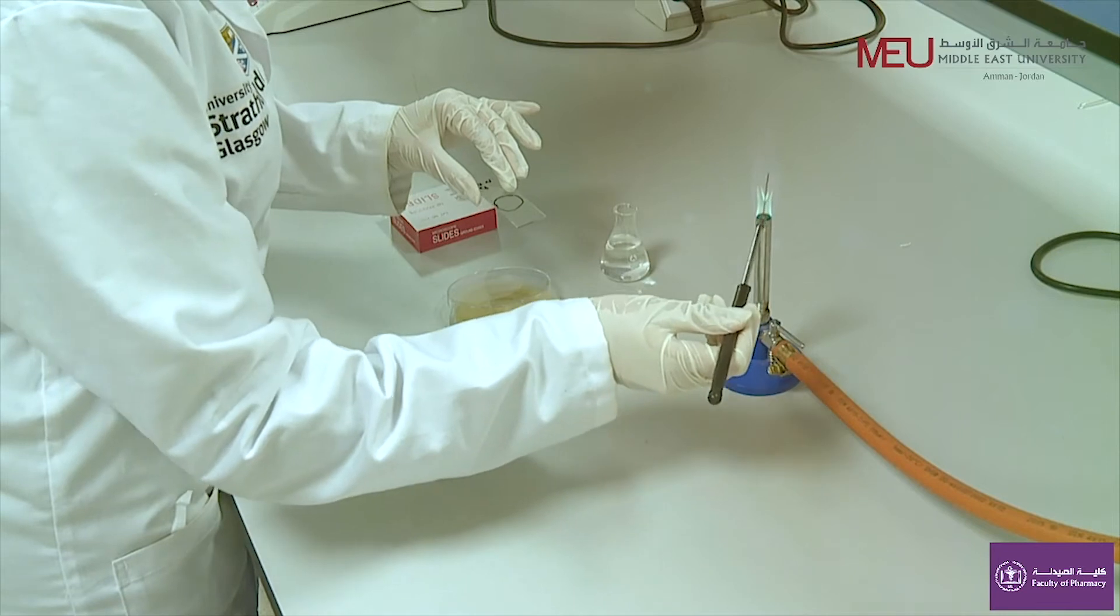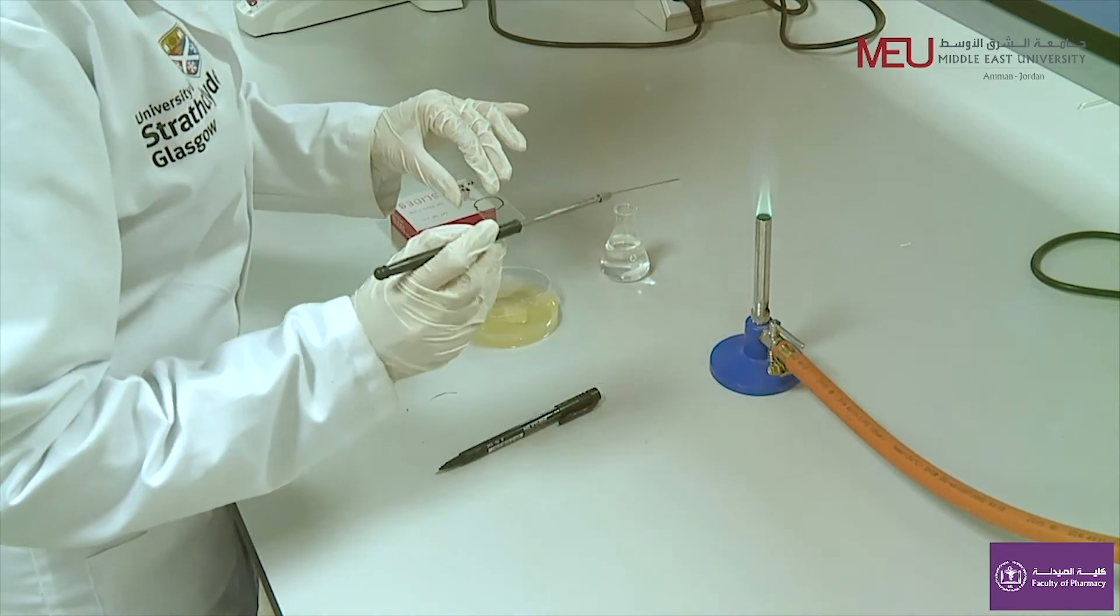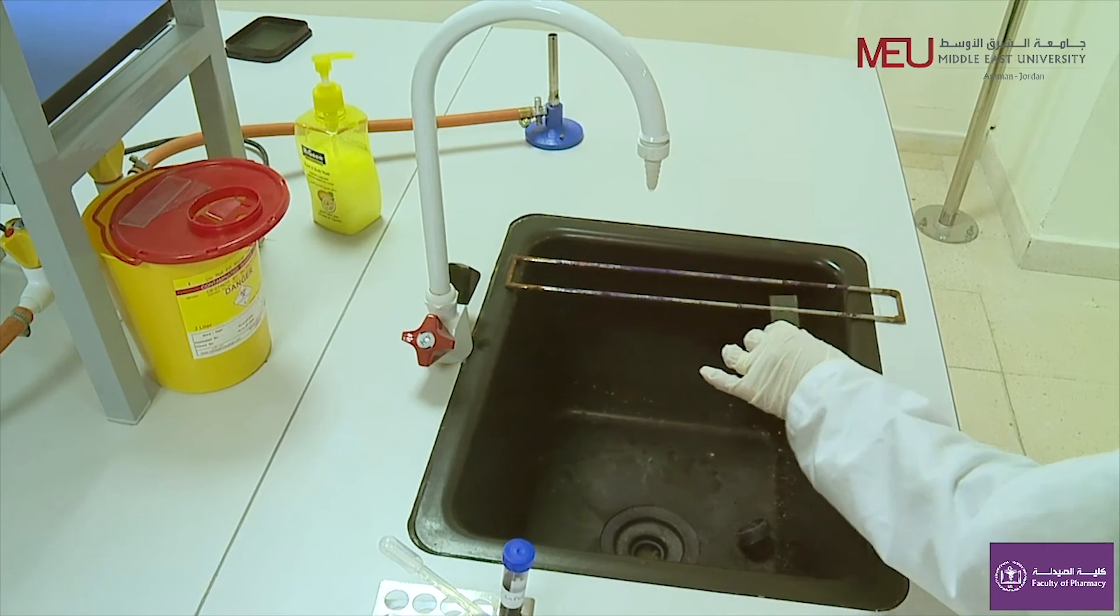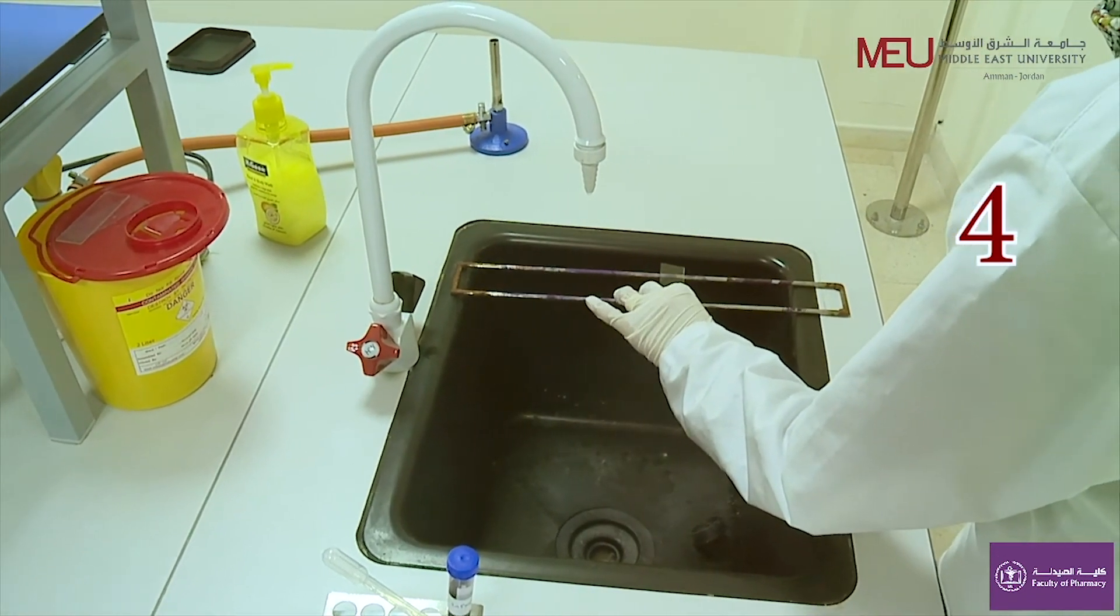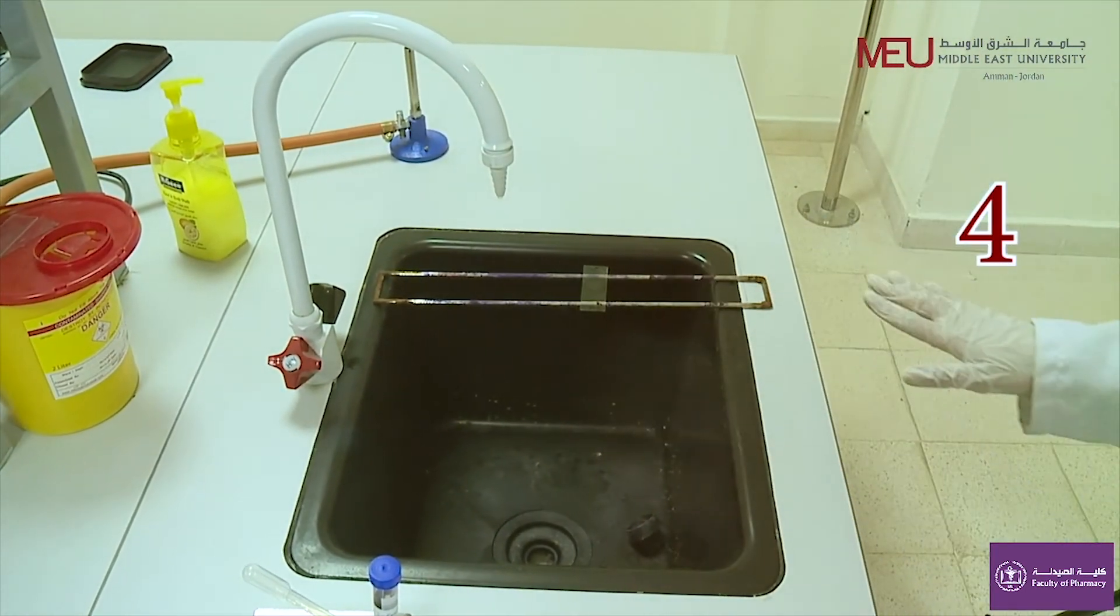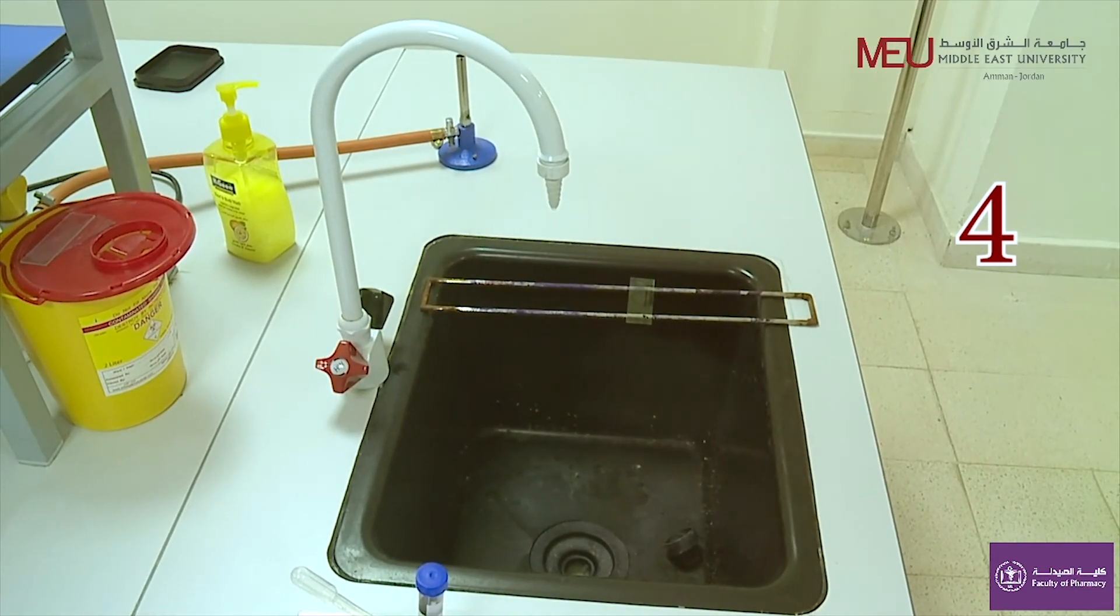Finally, flame the loop to disinfect it and leave it on the bench. Allow the smear to air dry at room temperature. It is very important to let the smear dry completely to get a good stain.